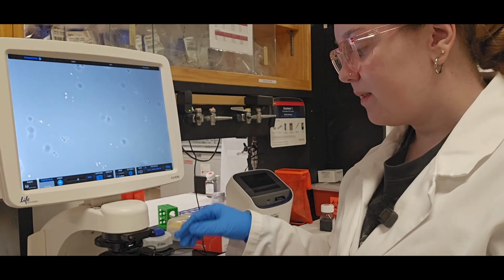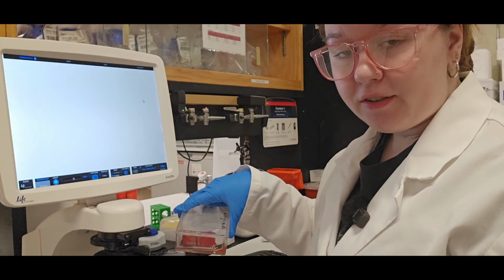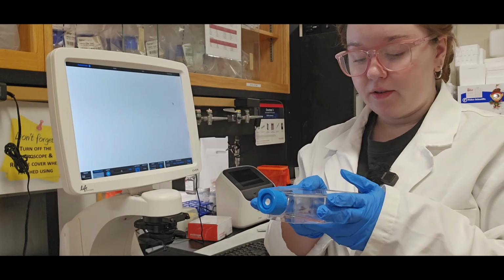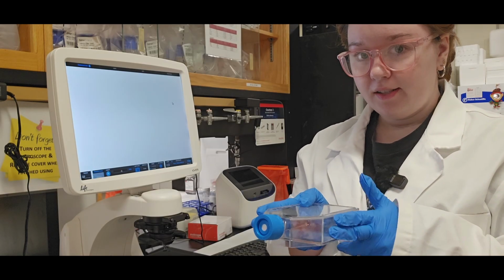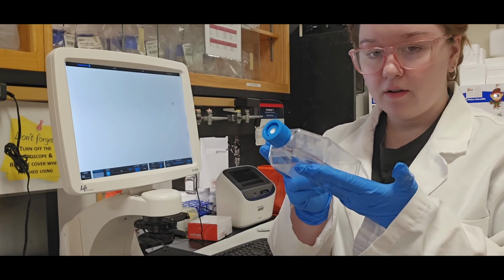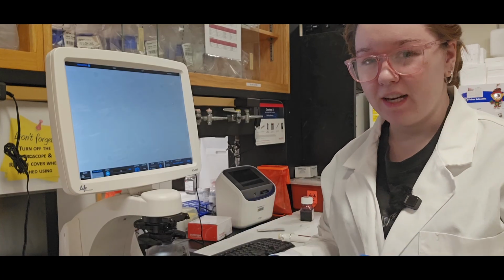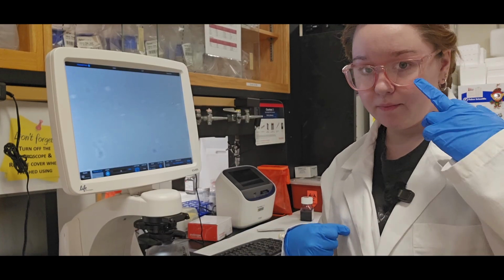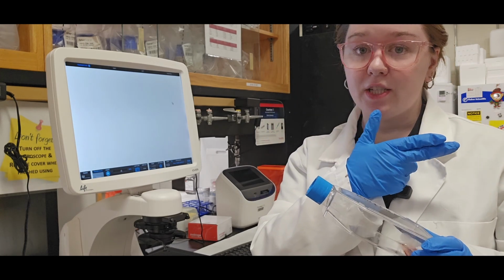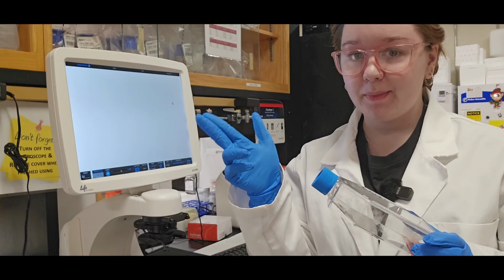If it was like this, but then like tiny spots maybe still attached, you can do a 2-finger tap method where you take the flask, hold it parallel to the ground, tap it with 2 fingers, just to kind of jostle and get the cells off of the surface. Recheck it to make sure that it worked. And then if that didn't, then I would incubate again in the incubator. But these are detached, so I'm gonna go ahead and do the next step, which is adding 2 times media to this, putting it in the conical tube, and then spinning it down.